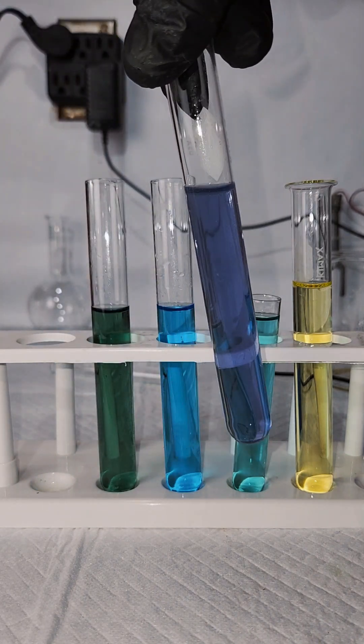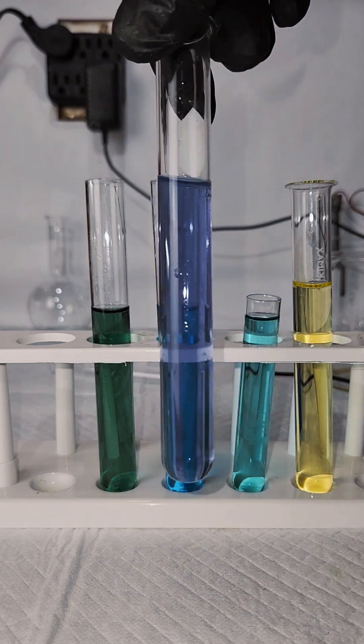It's not a true oxidation state so much as an intermediate, but I think it looks cool, so I kept it.